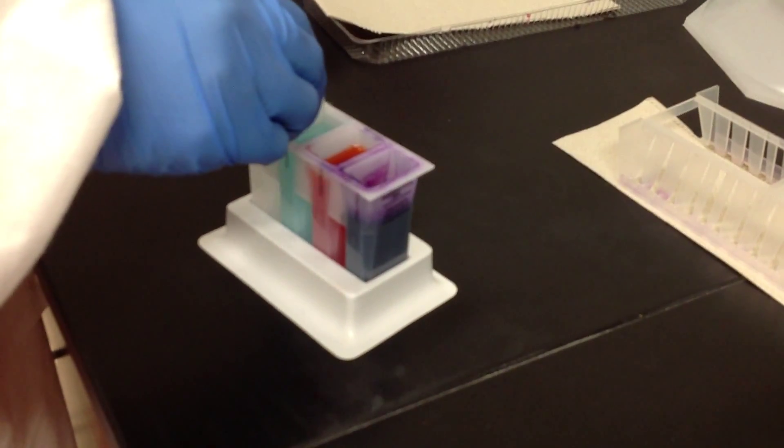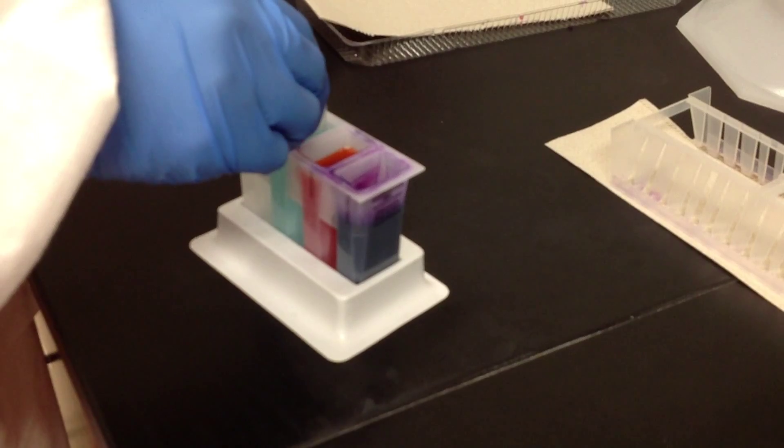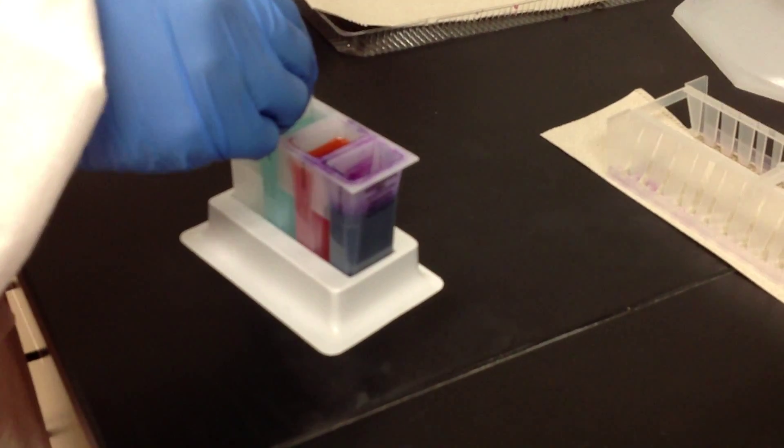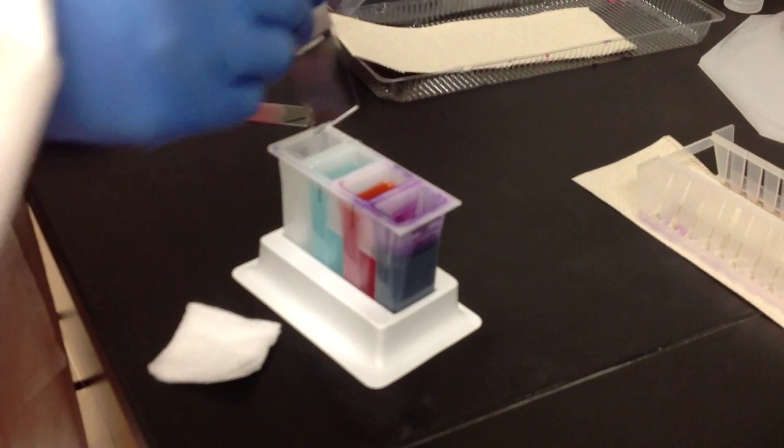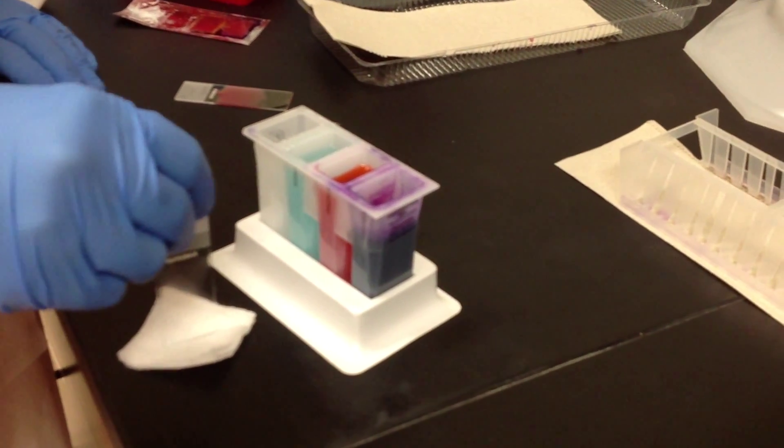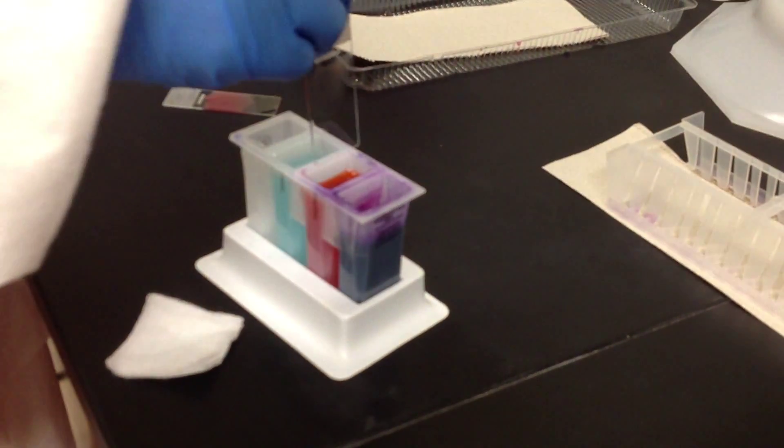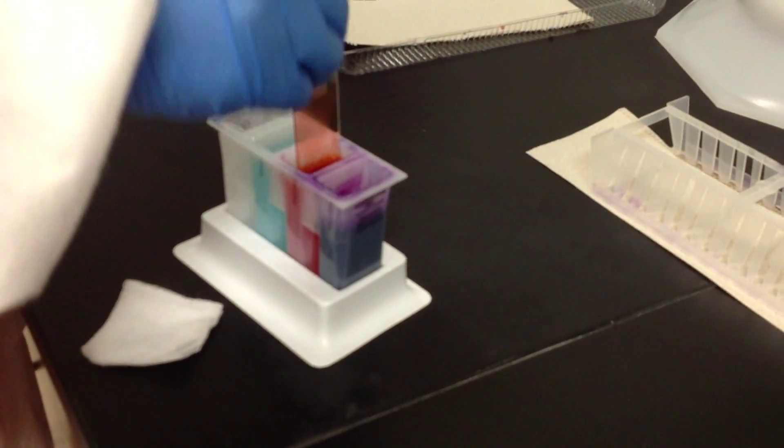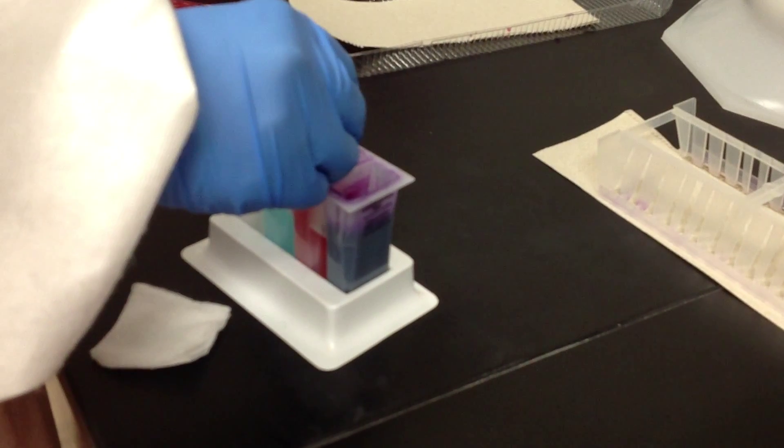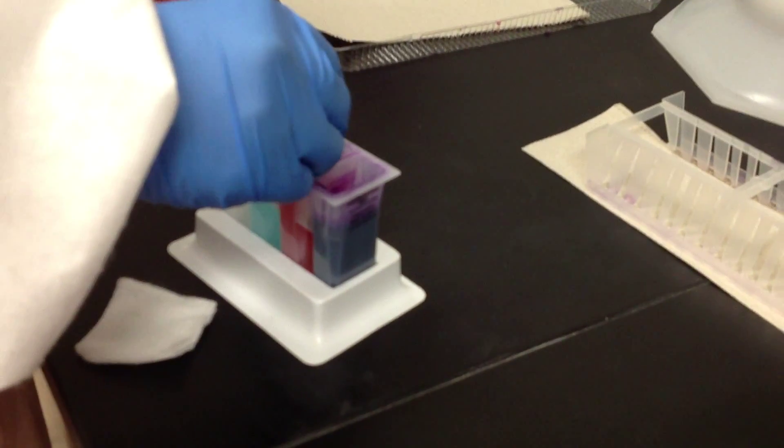We still have the water running. You always want the water running before you get started. I'm just going to blot the end, then immediately begin the five dips in the first stain solution—five one-second dips. Do make sure that it gets good and covered.